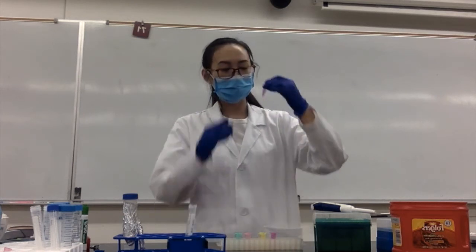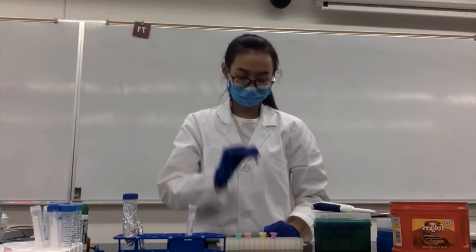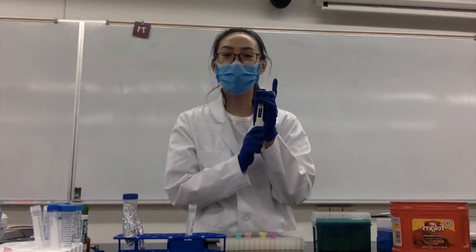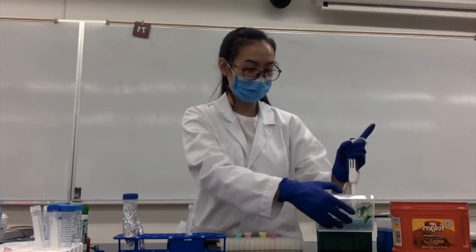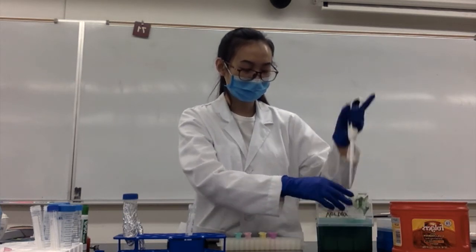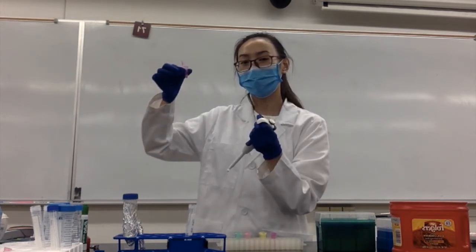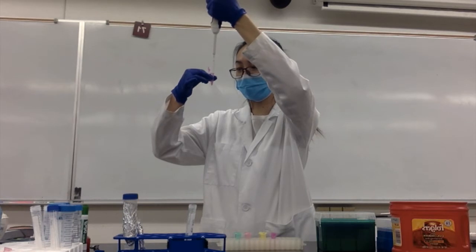Next, we need to remove the supernatant from each tube. First, set the micropipette to 130 microliters, then get a tip for the micropipette, find your cell sample, and remove the supernatant without disturbing the cells.